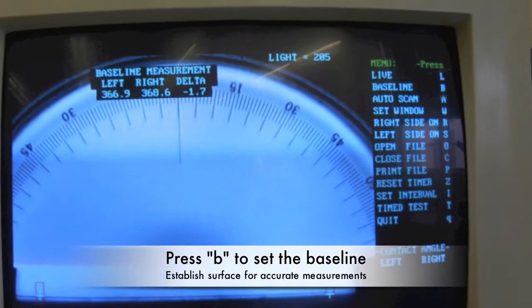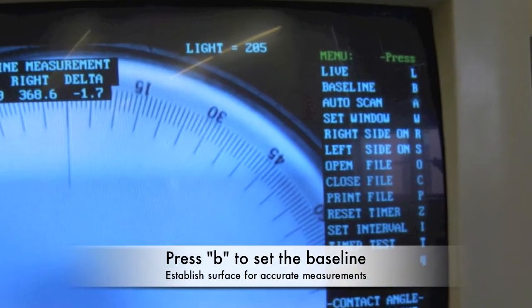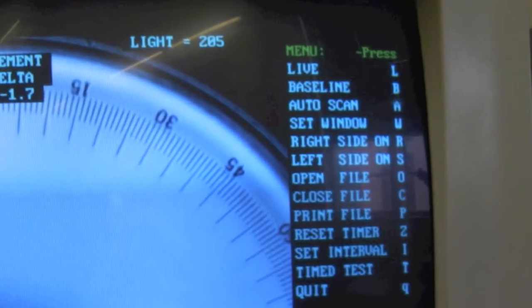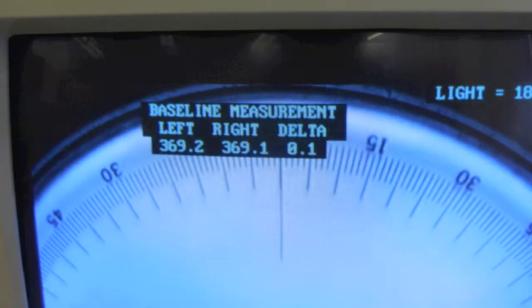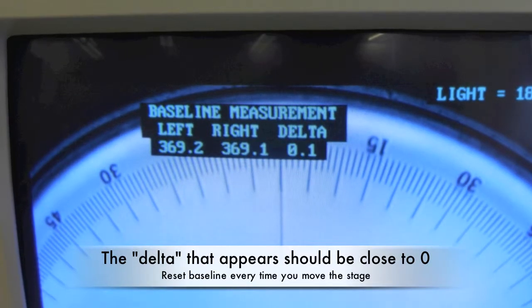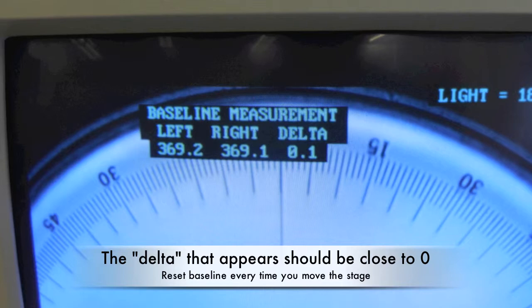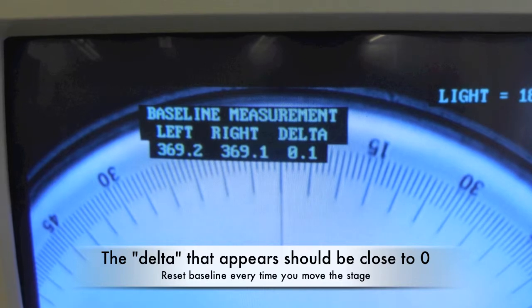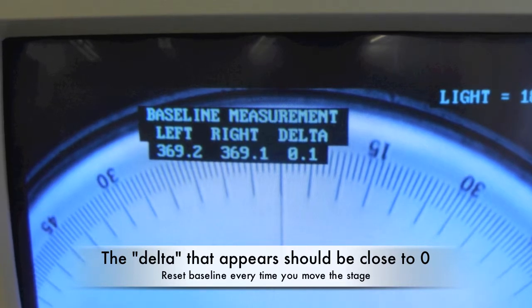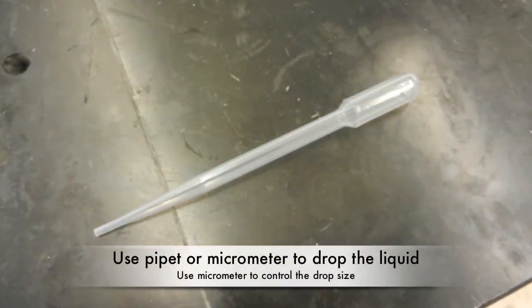Press B to establish the baseline. This is needed to establish the substrate surface for accurate contact angle measurements. The delta that appears should be as close to zero as possible, or just slightly positive or slightly negative. Make sure to reset the baseline every time you move the stage or if you aren't getting the proper delta value.